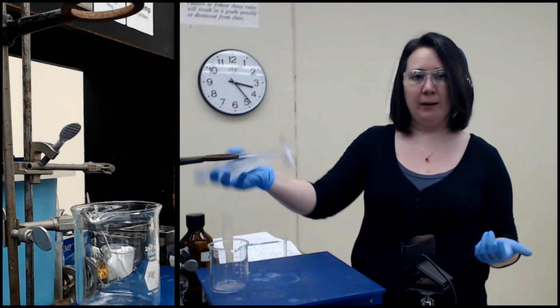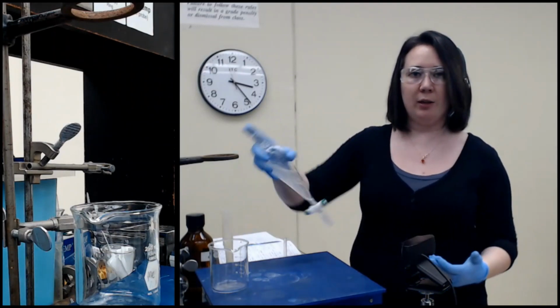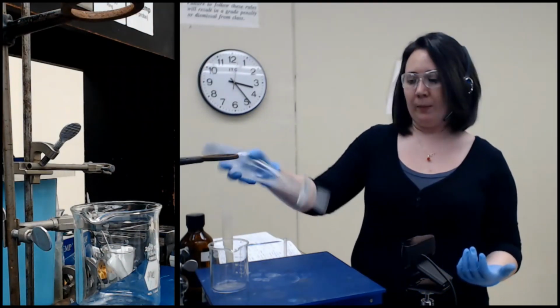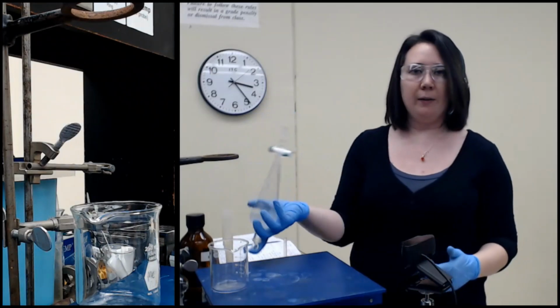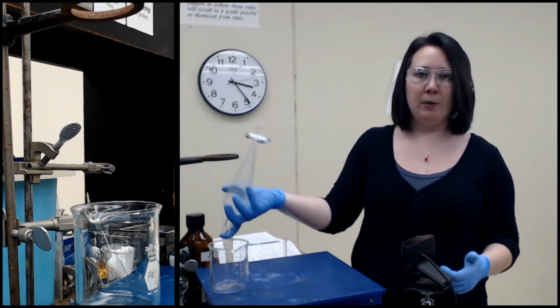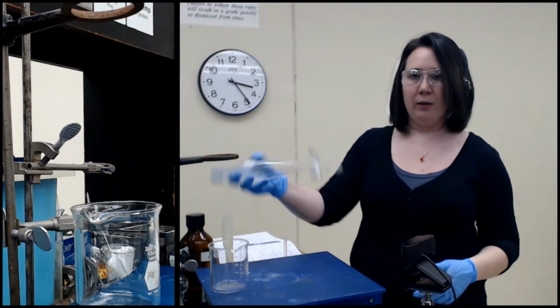So if it's a water-based solution, unless it's significantly different, like brine, maybe saturated sodium chloride, we're going to go ahead and just assume about 1. I suppose you could calculate it, but 5% sodium bicarbonate is simply 5 grams of sodium bicarbonate plus 95 milliliters of water. I would bet the density is still pretty darn close to 1.0. It's certainly not going to be less, so ethyl acetate is going to be on top.